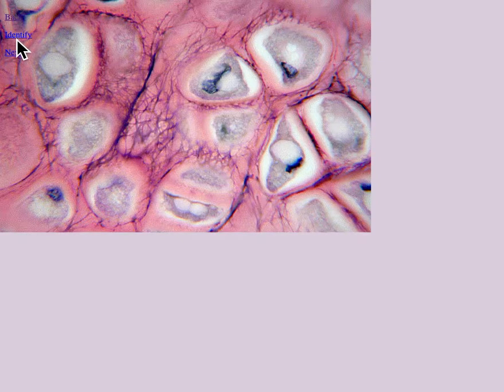Again, another example of elastic cartilage. It has a moderate number of fibers. Remember, hyaline, no fibers. Elastic cartilage, moderate fibers. And fibrocartilage, lots of fibers. So besides your ear, another place where you find this tissue is surrounding your eustachian tube. And so that tube will distend and recoil every time your ears pop when there's pressure changes.